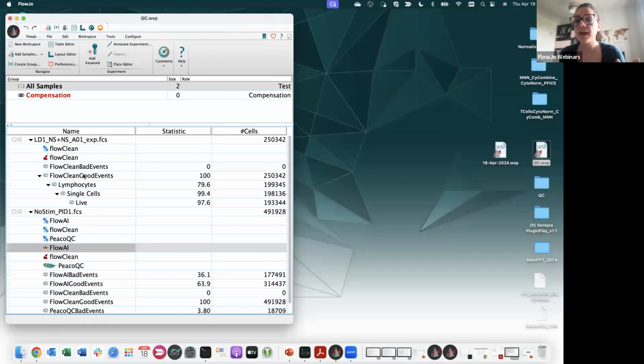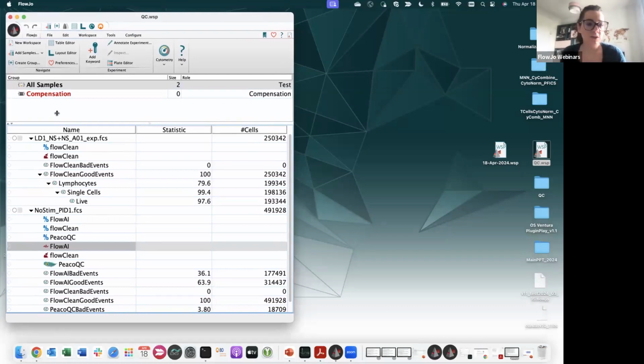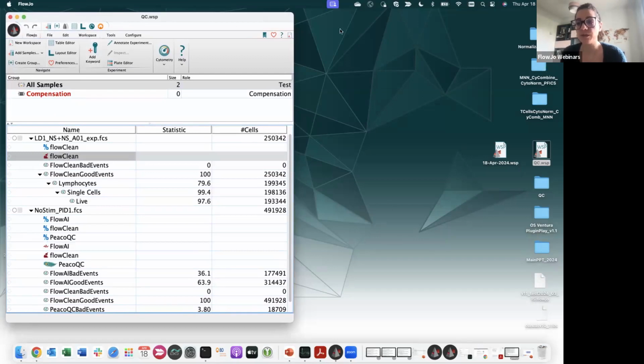And this is true for every plugin that you use in FlowJo. So if you do your analysis and you're happy with that, you can remove the nodes from any of the plugins that you use in FlowJo. So you don't need to recalculate every time. Okay.